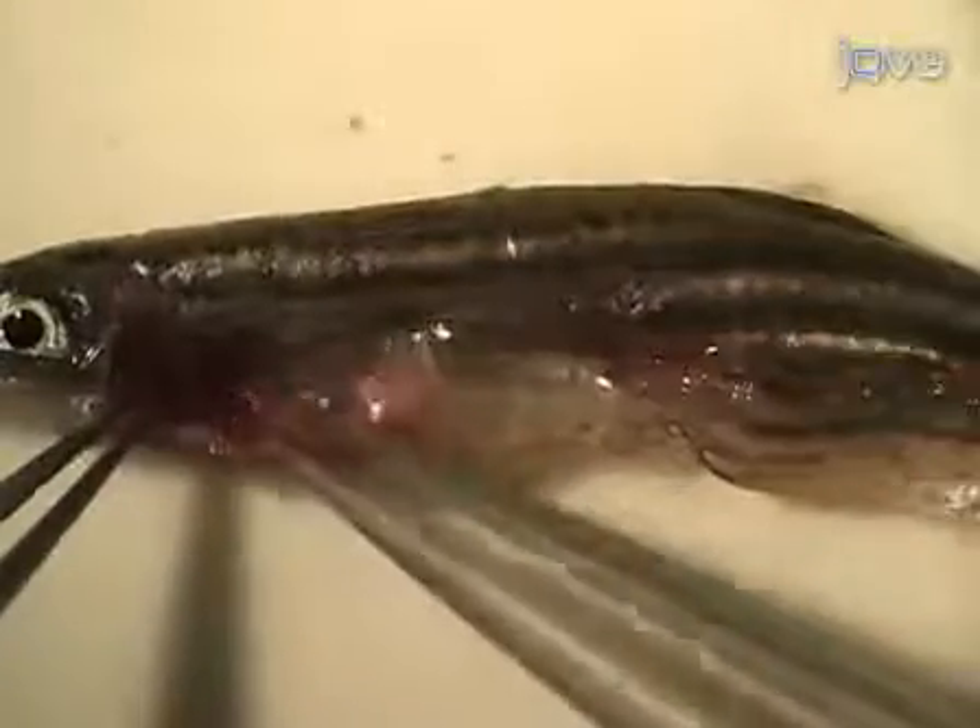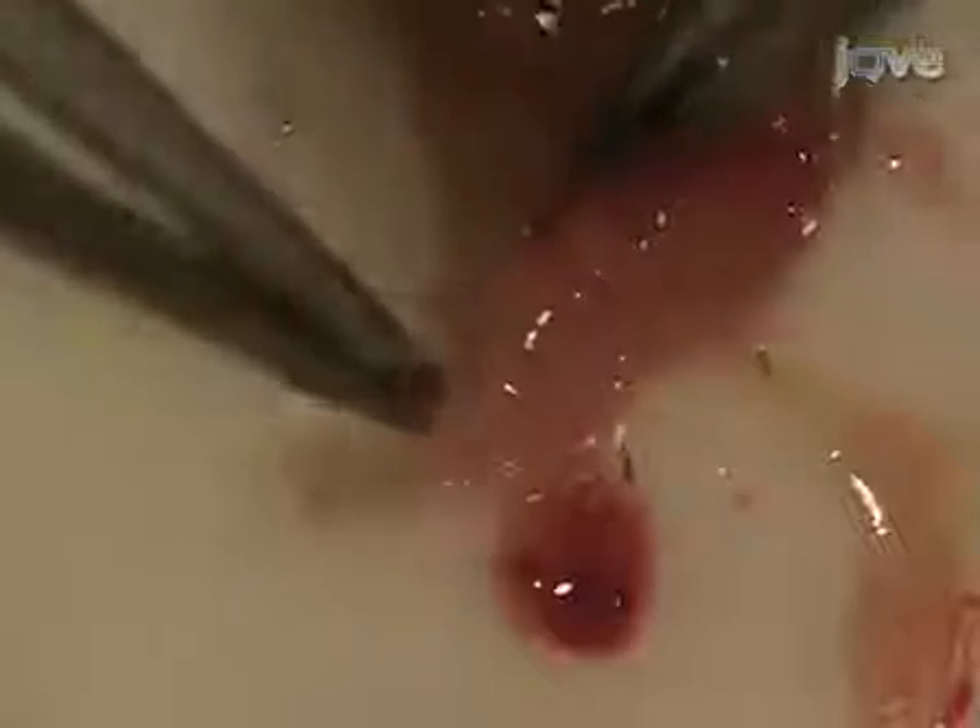Next, remove the gastrointestinal system from the body cavity of the fish. The gallbladder, a green translucent fluid-filled sac, and the spleen, which appears bright red, are found within the viscera. The liver can be identified by its large size, lobed morphology, tannish color, and extensive vascularization.